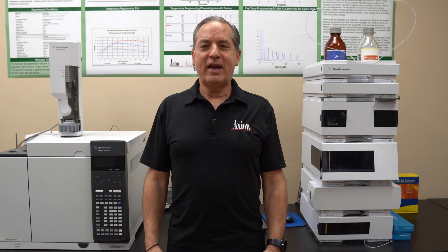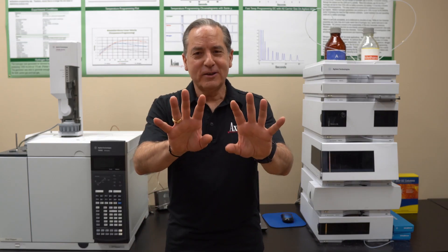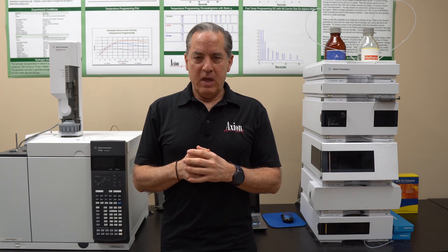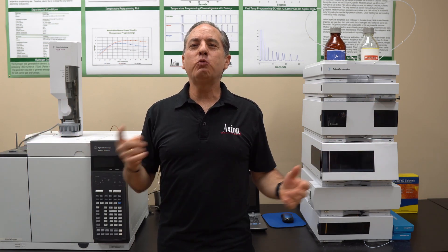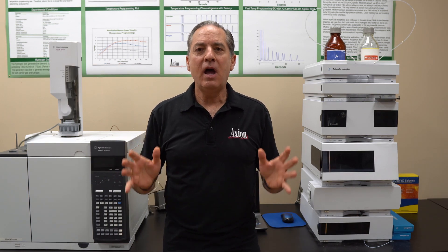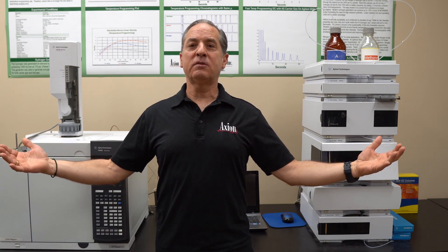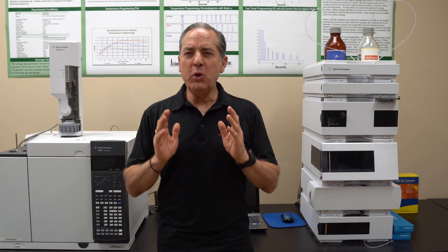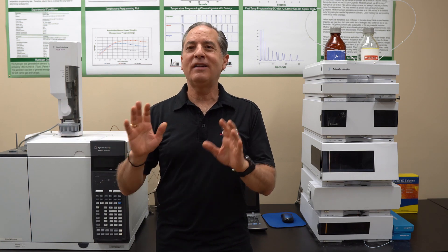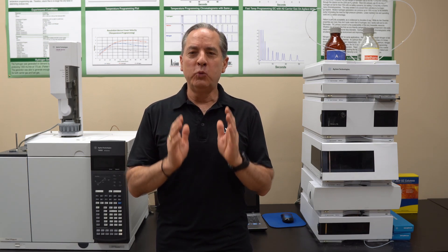If your chemical isn't in a catalog, here's the next step. In HPLC we have dozens of column types, but one dominates: about 85% of all column sales are reverse phase columns. That tells me 85% of problems are solved by reverse phase. So when you enter HPLC, assume you're going to be doing reverse phase. Not everyone — 15% won't be — but let's play the odds. You're probably going to do reverse phase.